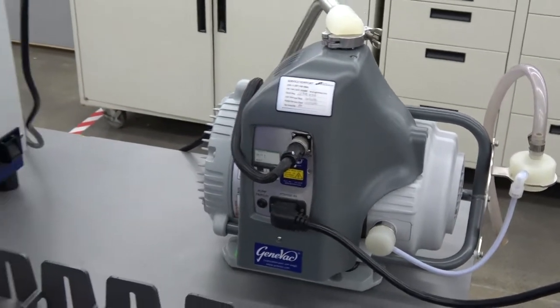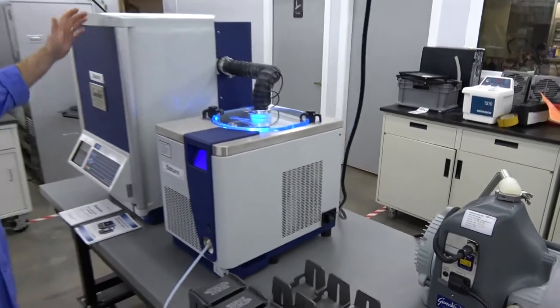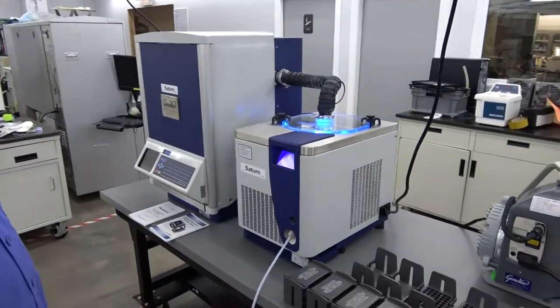So everything is running. You got the condenser running, the pump. This is spinning. So very minimal noise in the lab.